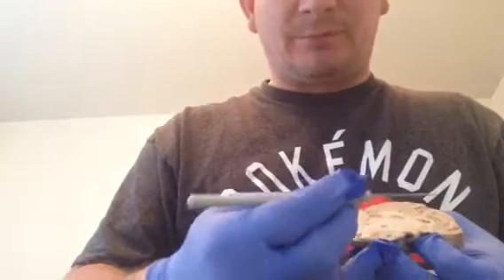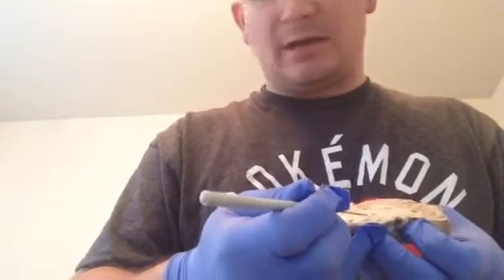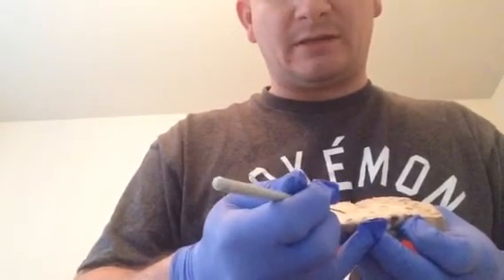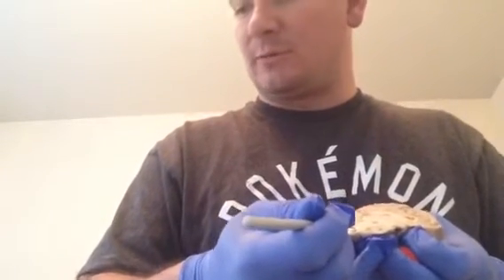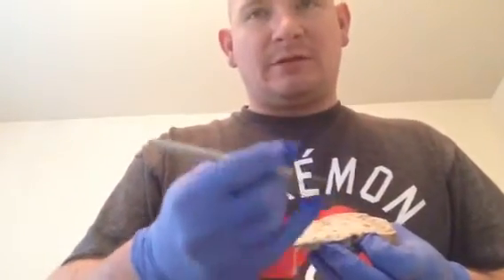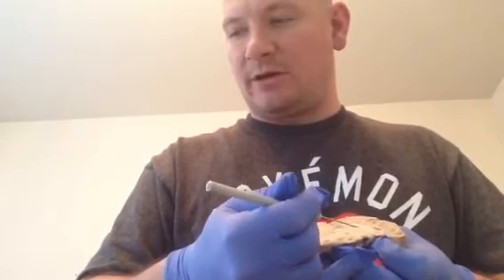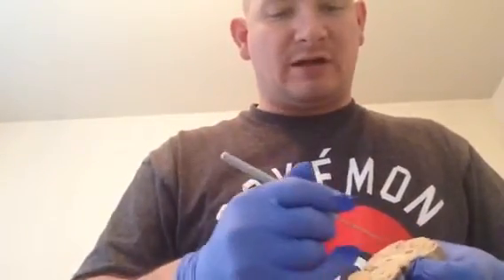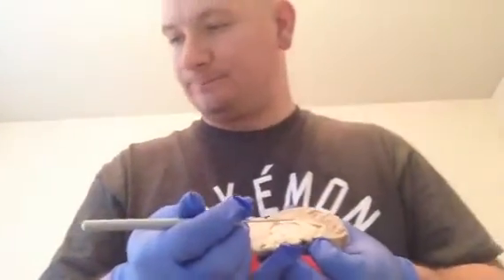Then we go into the brain stem, starting with the midbrain, which appears to be this portion here, marked up front. Then we move down to our pons and then to our medulla oblongata. So we got our midbrain here, and then this appears to be the pons, which would be displaced if the spinal cord was coming straight down, and then our medulla oblongata below that. The cerebral peduncle would be the midbrain mass itself, and then the superior and inferior colliculuses would be these four nodules that push out of the front, with superior being higher than inferior.